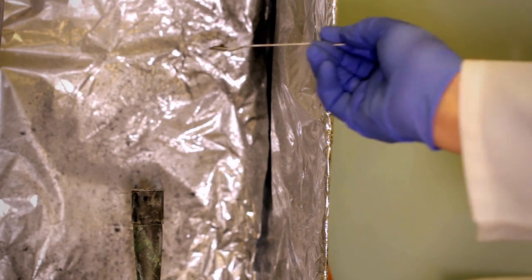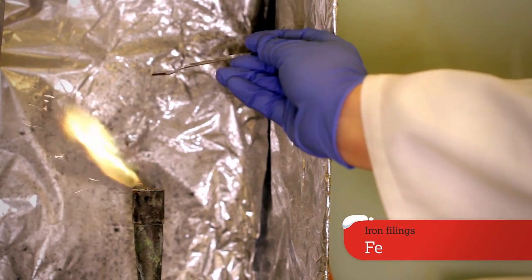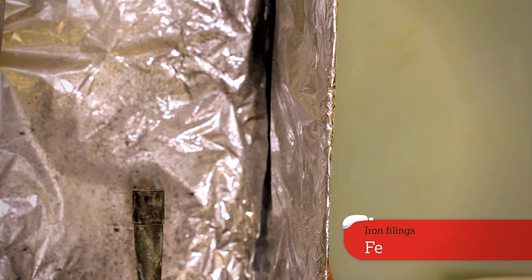We're going to look at some metal powders and these are often used to make the golden rain or silver rain that you get in fireworks. Iron when it's in very small pieces if it's put into a flame it will give you a golden rain.